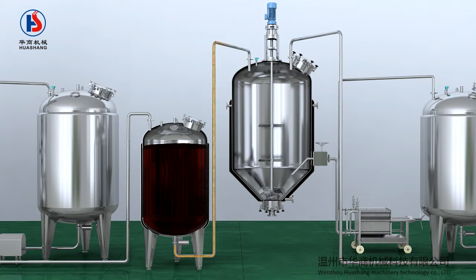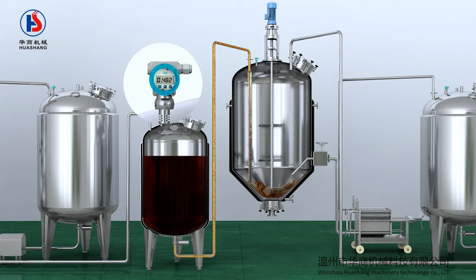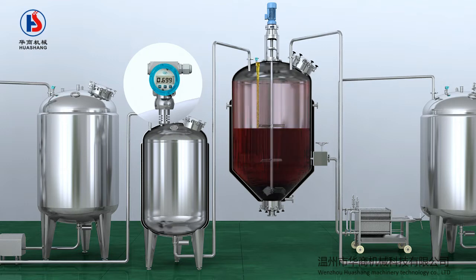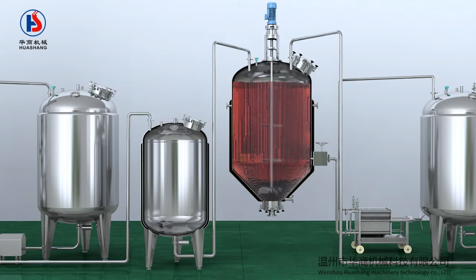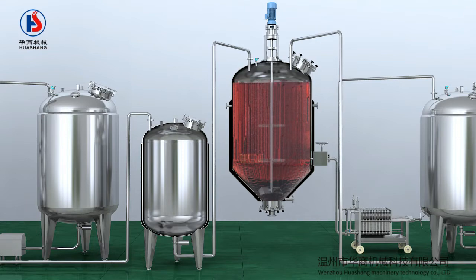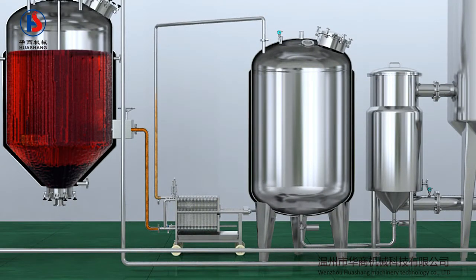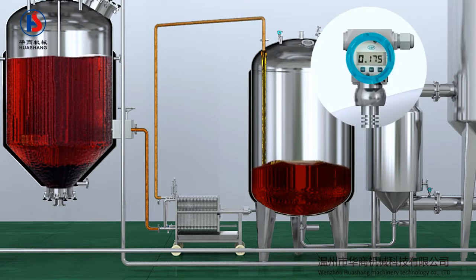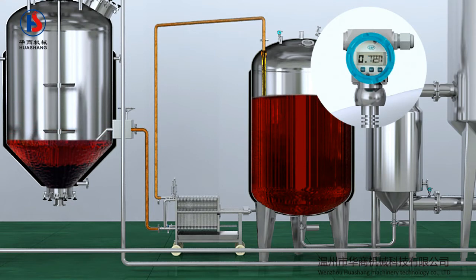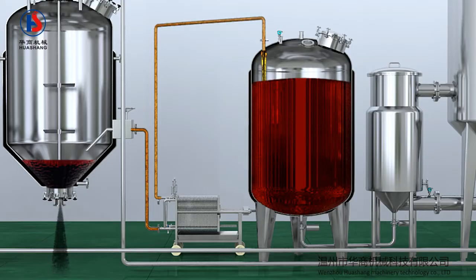Setting the technological parameters, the solvent such as ethanol is fed into the alcohol sedimentation tank through the flow system. Open the mixing system and mix the material at the set speed and time. When completed, the precipitation process starts. After the completion of the precipitation process, open the side valve. The liquid supernatant will be transported to the storage tank through the frame filter. Then open the bottom valve of the alcohol sedimentation tank to discharge.